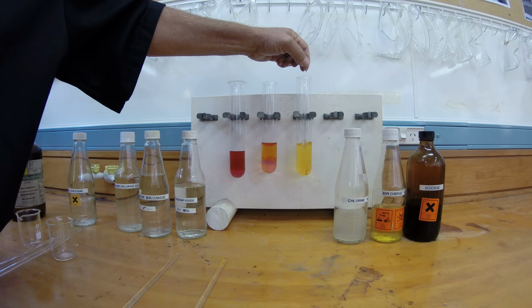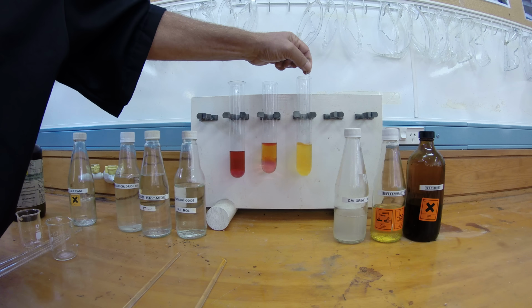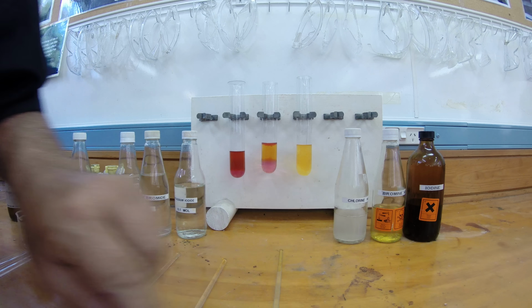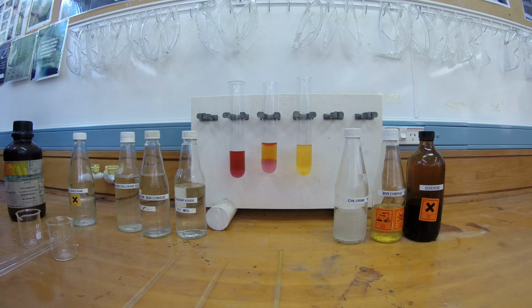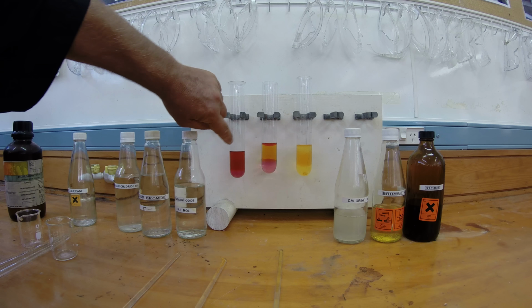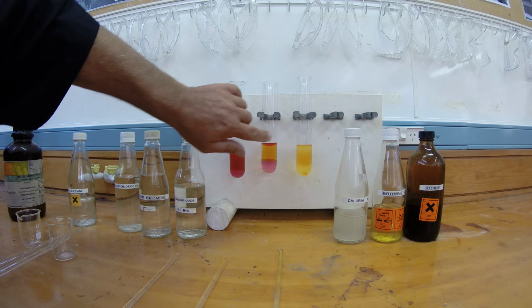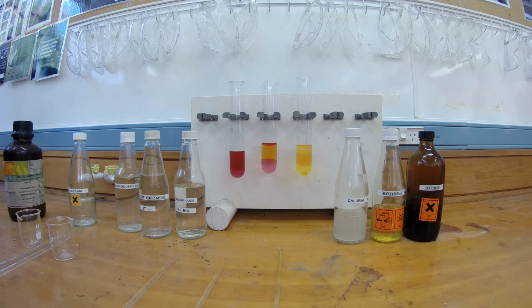This one didn't do exactly as I wanted. Oh, I can certainly see 3 layers in the middle one, can't you? This one over here, it's hard to say. It looks like there's another layer in the top there, and there's certainly another layer there. So we're settling out to 3 layers.